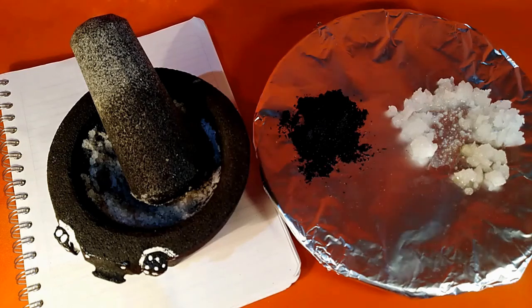So this is just a thing about salt and a lot of chemicals in general. They're hygroscopic, right? They absorb water right out of the atmosphere and you don't see it. But sometimes it turns out that when we do a chemistry experiment, what we thought we had wasn't exactly what we thought we had because there was a lot of water weight in there.